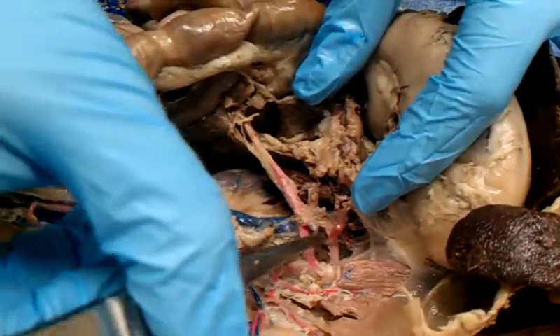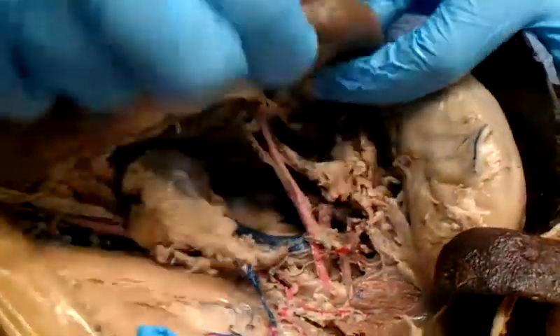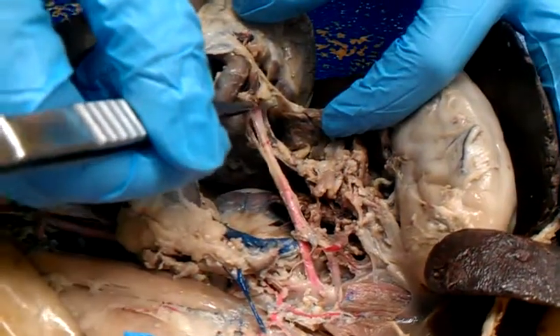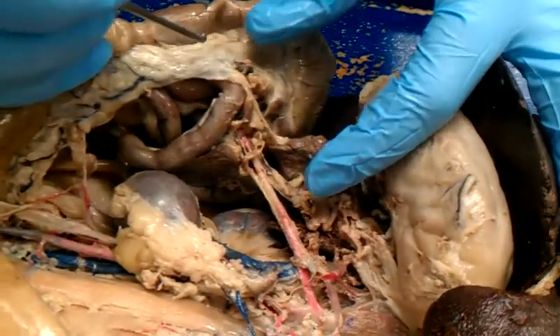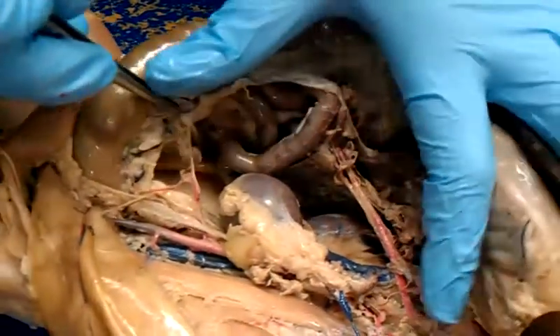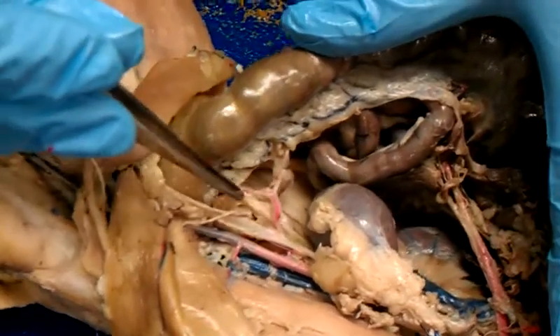Then we've got the superior mesenteric. This is our intestinals, and that might show up in here too, but ours isn't dyed very well. Coming off of the intestinals is going to be the beginning of our colic, right? Or colic. Colic, like when babies get colic. And it runs through here, but it's not dyed very well, down to our inferior mesenteric. And then this is going to be our superior hemorrhoidal.